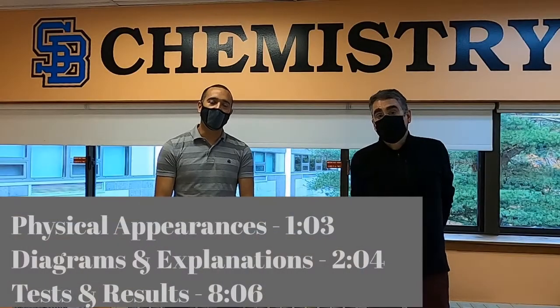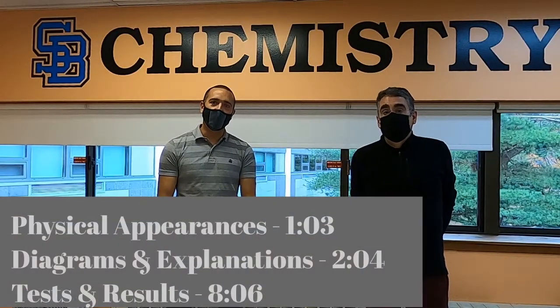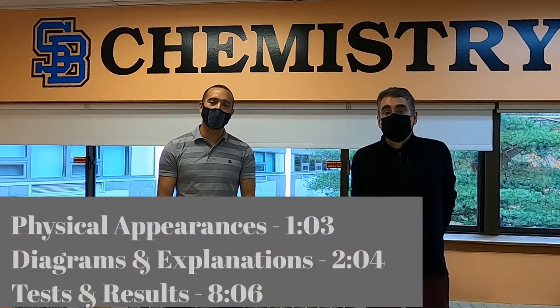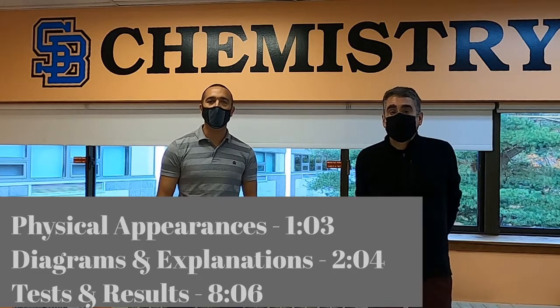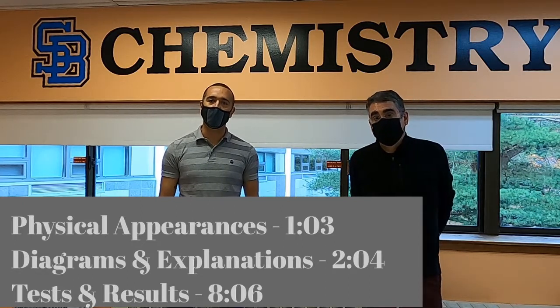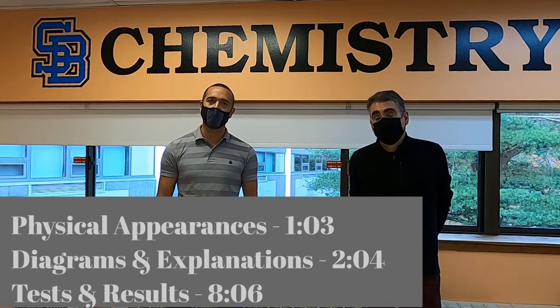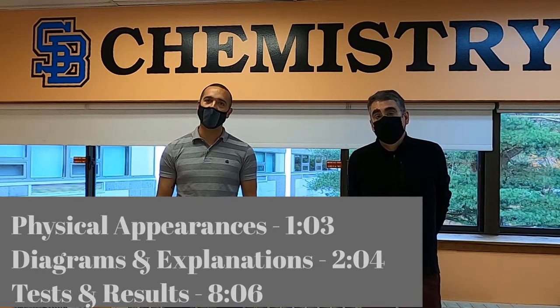Hi, it's Mr. C and Mr. Risner, and we're here today to go over some things to explain and show you how to do the Group 1 and 2 metals lab that we'll be doing to study parts of the periodic table.